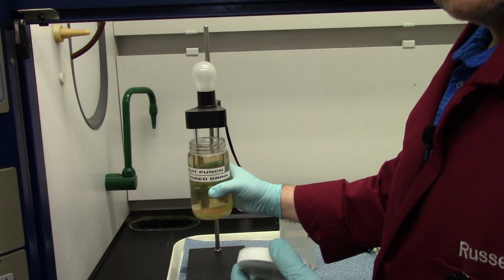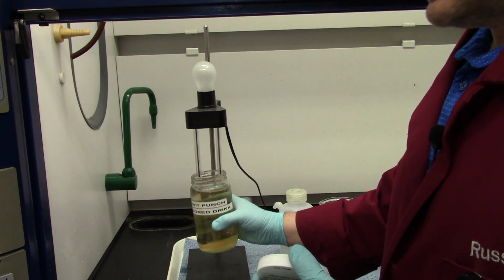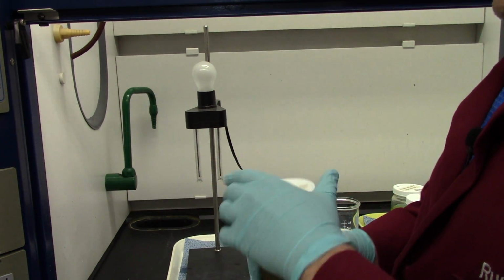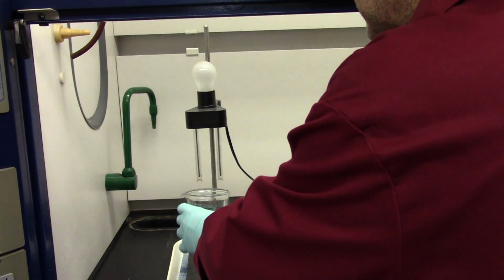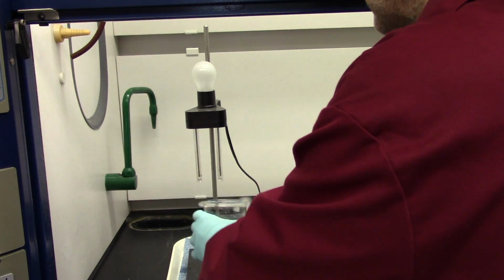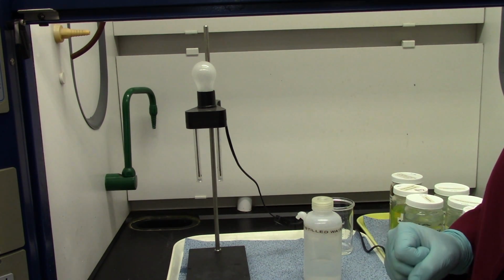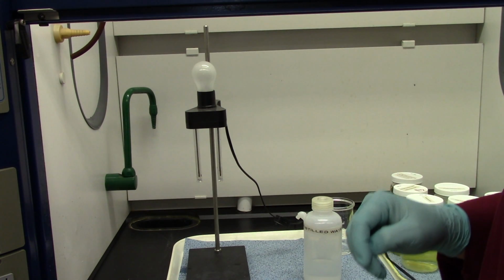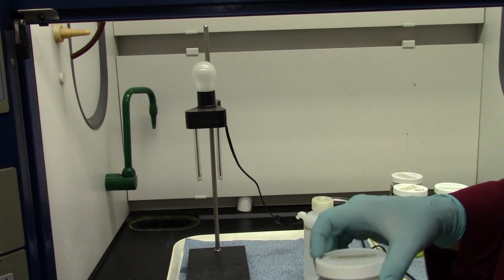Citric acid is a weak electrolyte, but as you can see, the light doesn't come on, and that's more than likely because the concentration of citric acid, which is a weak electrolyte, is so low that it doesn't register on our test. Now, that's something that you need to think about for a minute. Concentration does matter. Even though it's an electrolyte, the concentration is so low that there's not enough ions to conduct electricity. But citric acid is still a weak electrolyte. But you're going to put down negative for this. It doesn't light the lamp, non-electrolyte, because, quite frankly, it didn't light the lamp.